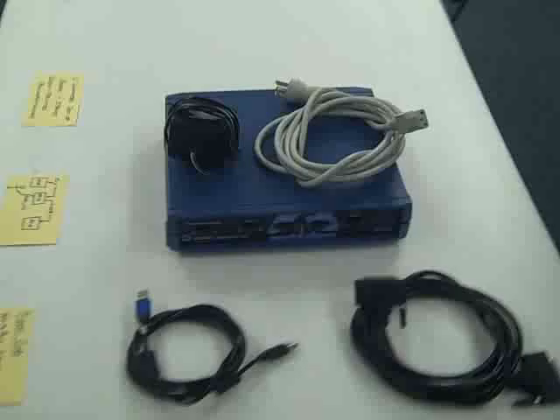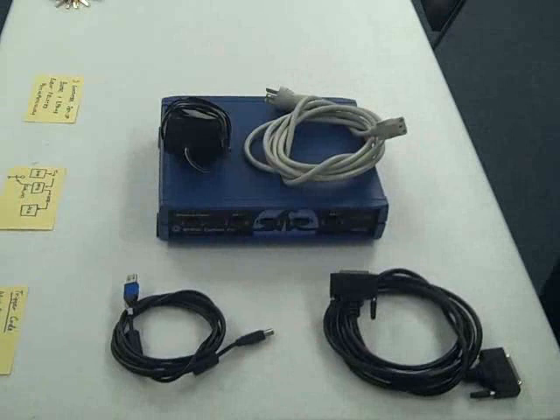Now Jordan is going to help us run this. So Jordan, if you would, let's start by taking the blue box and placing it where it needs to be for data acquisition. Just put it on top of those two desktops. I like to put it up here, create a little table for it so that it's easy to see.